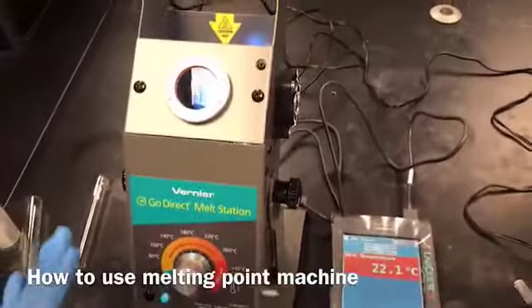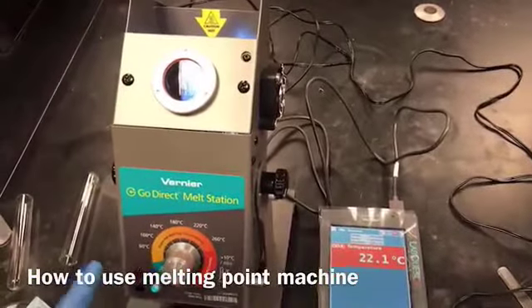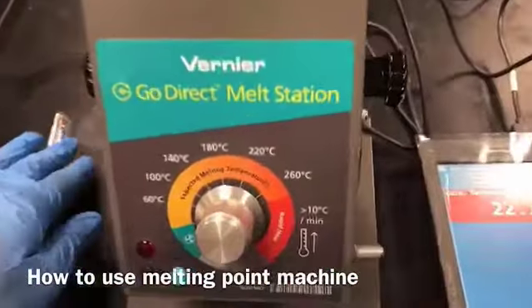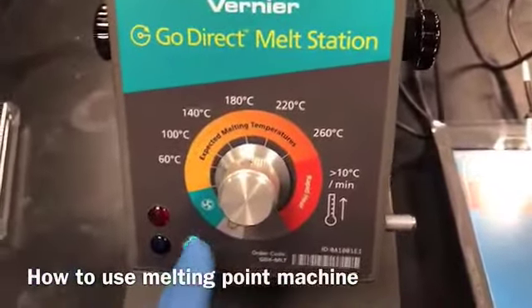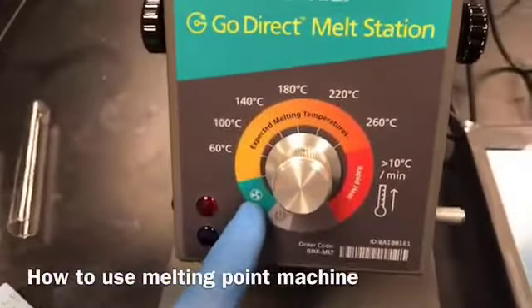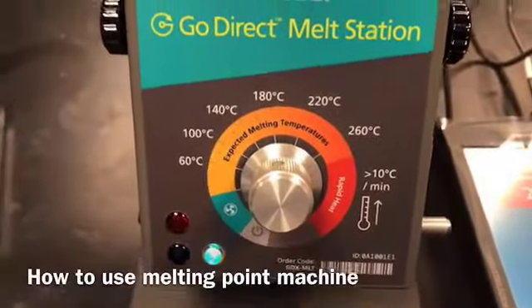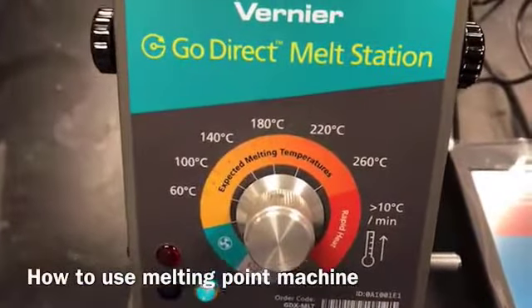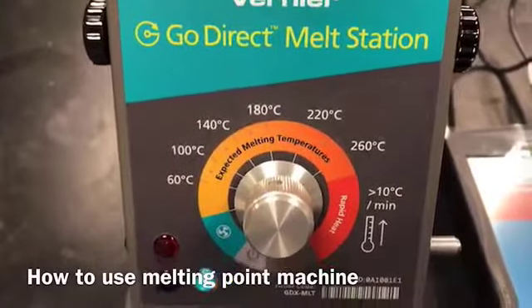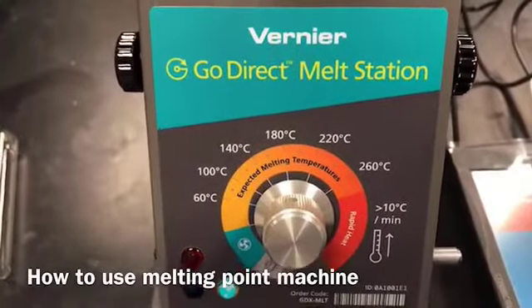this is the melting point machine which we are going to use. Okay, so let's focus on this area. Right now it is in the cooling mode, right? So it's not heated at all. I know the melting point of sulfanilamide. It is 164.5 to 166.5 as per the Merck Index.